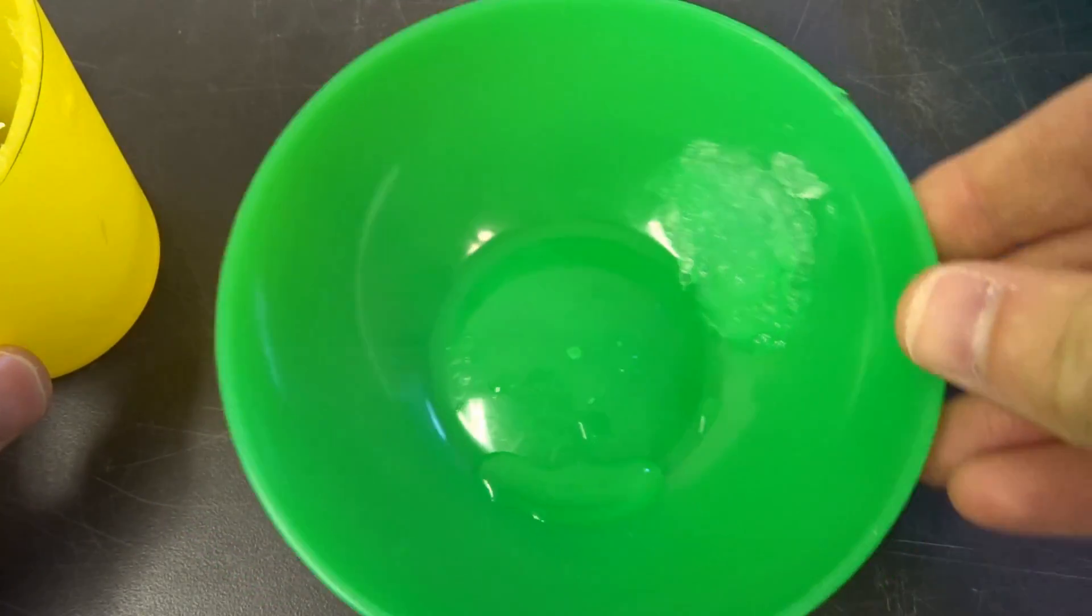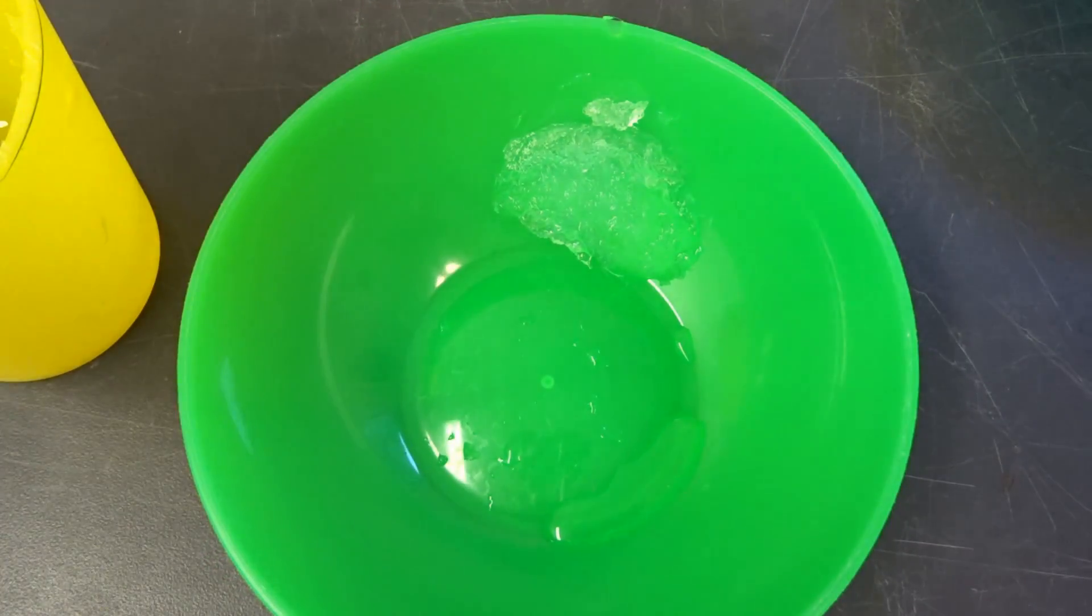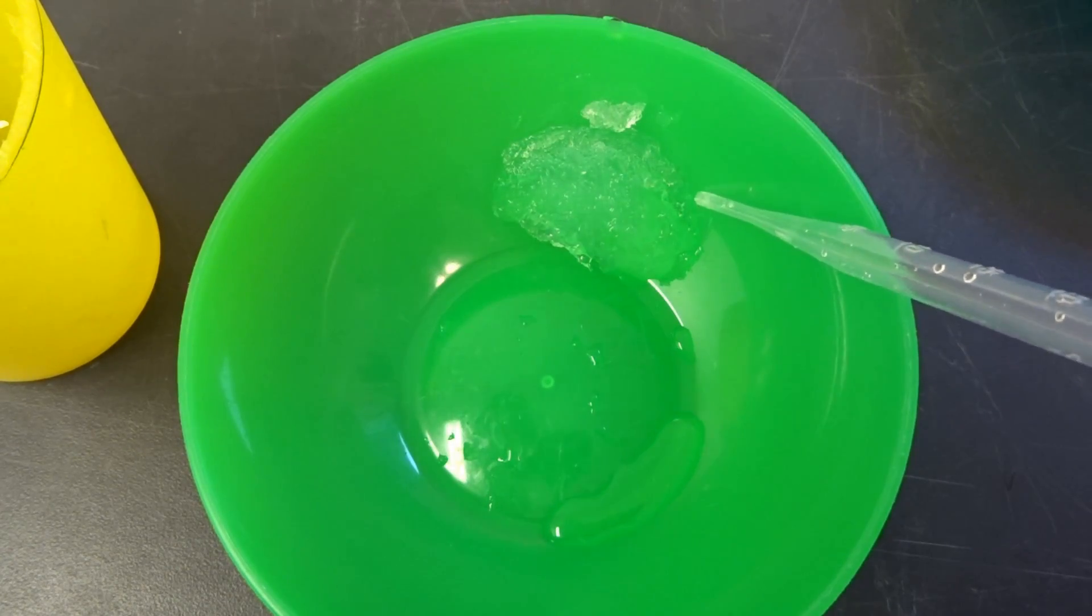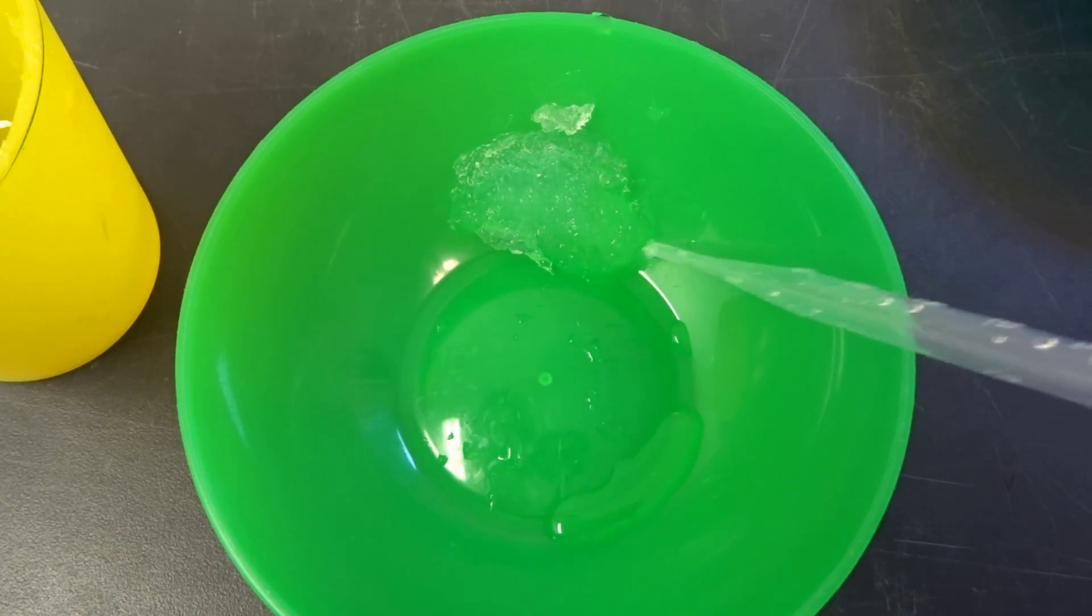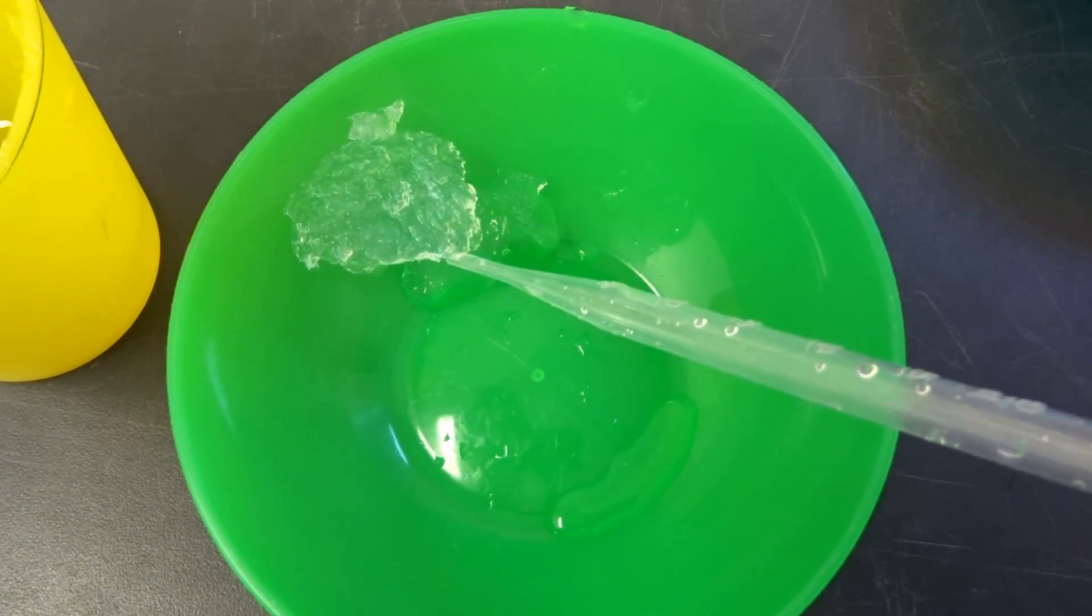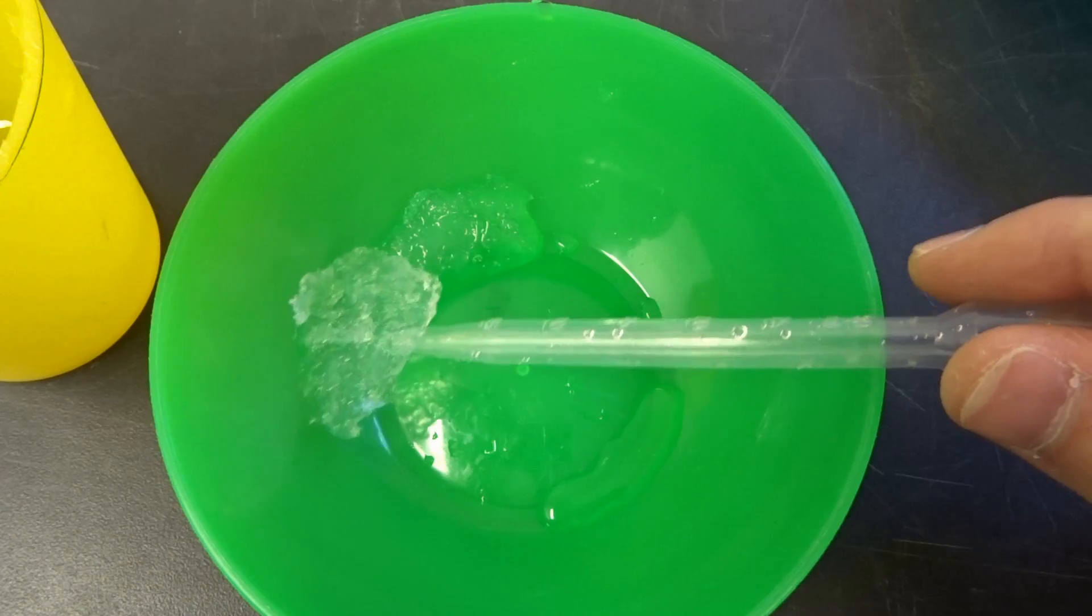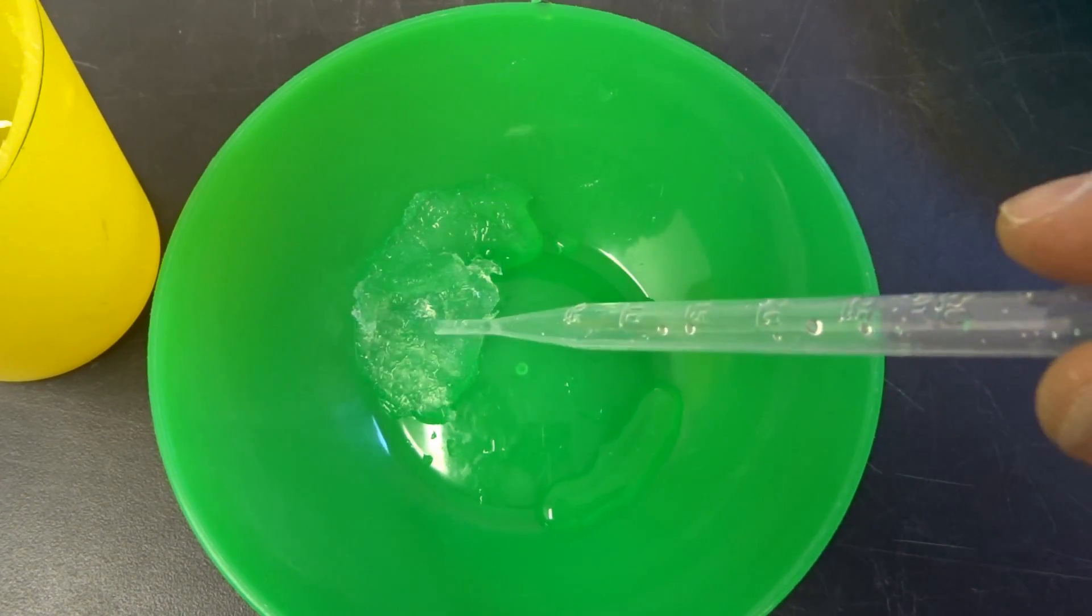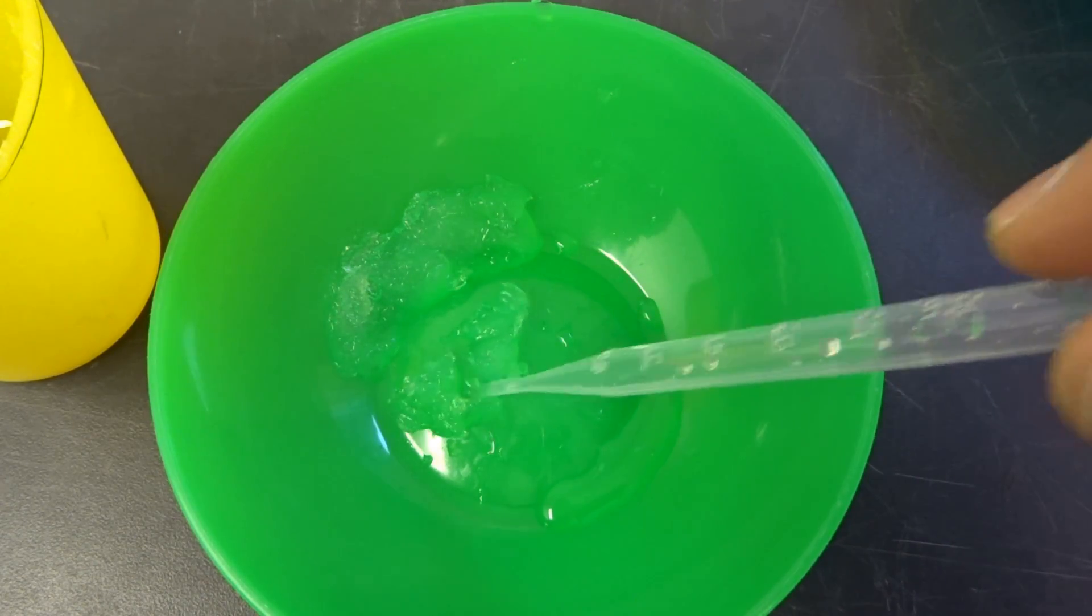But before I try to improve this process here, I want to use the gel you saw in the beginning and try to dry them. So primarily I plan this using solvent exchange, and at the end I'm going to say a bit about how do they shrink.